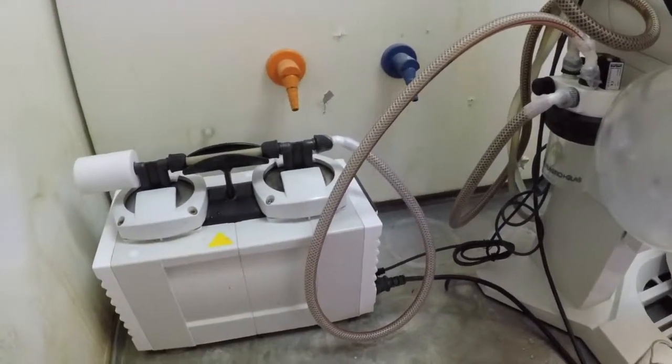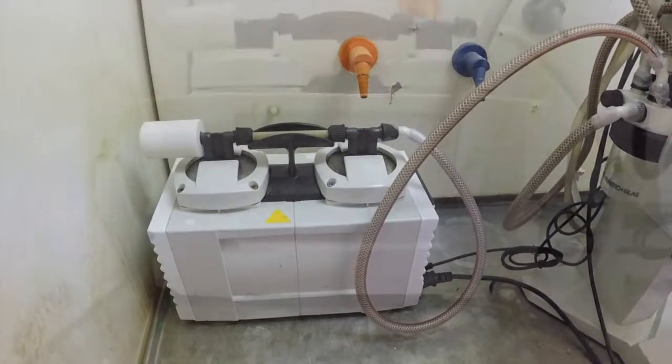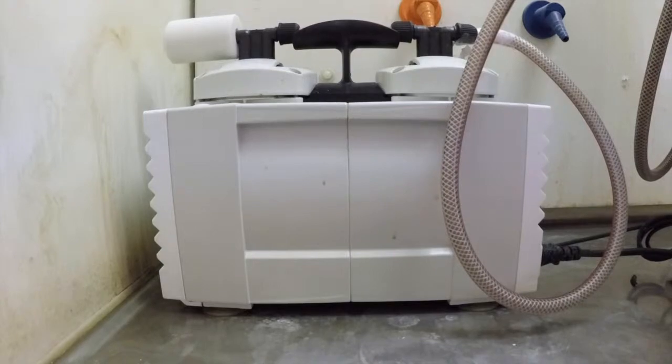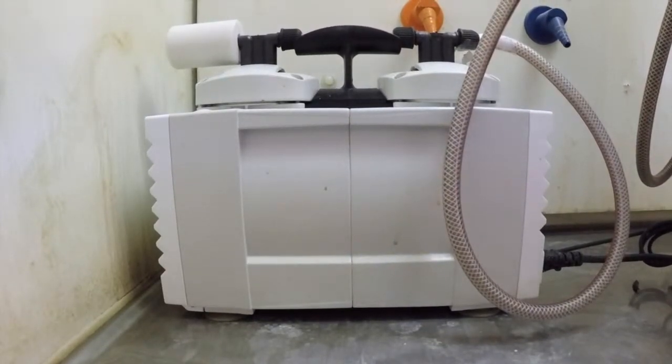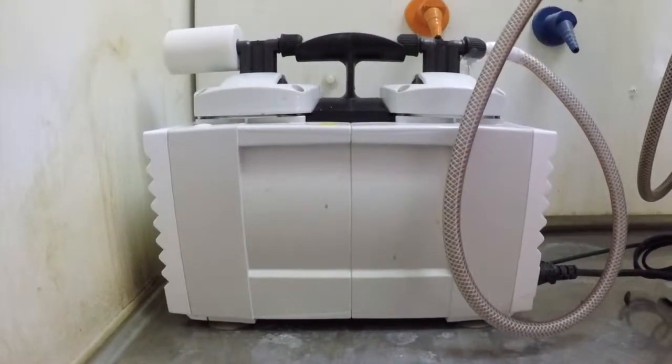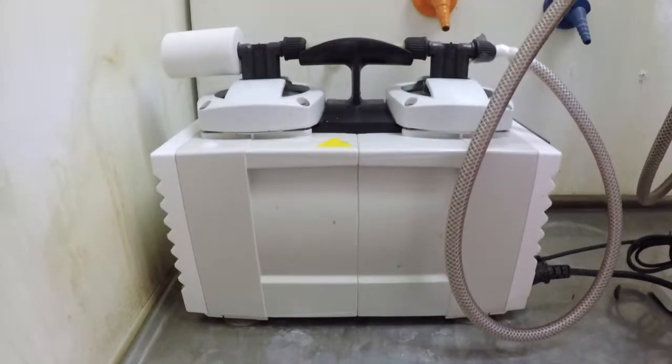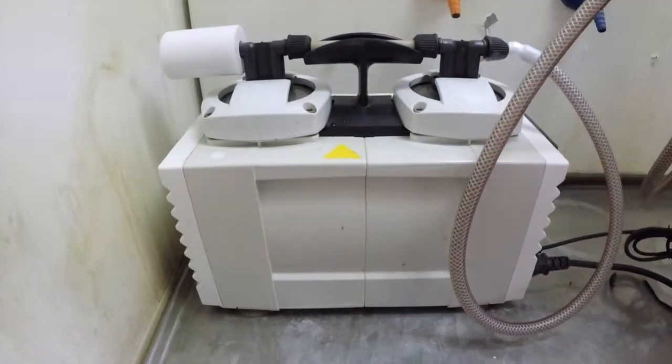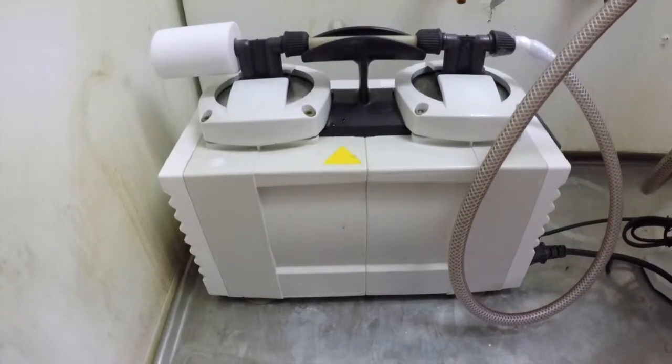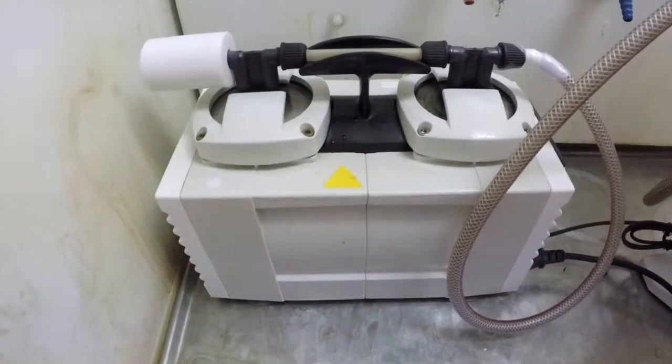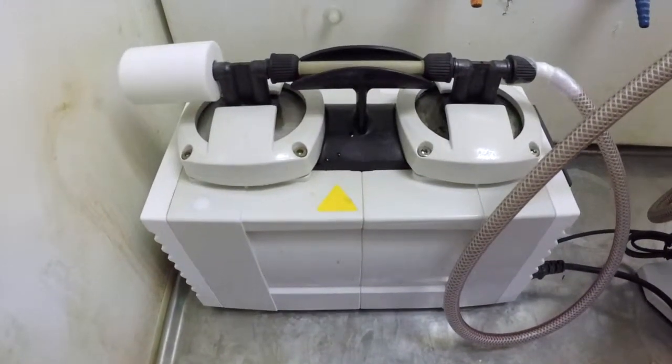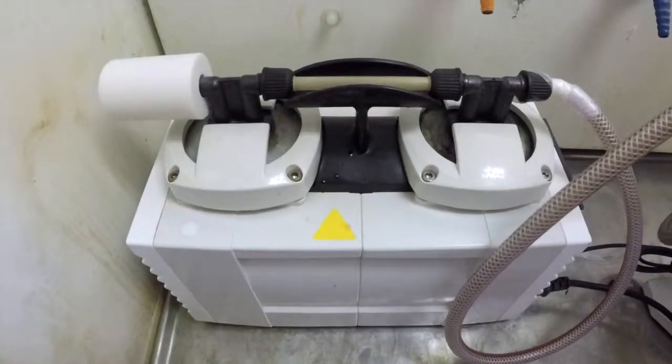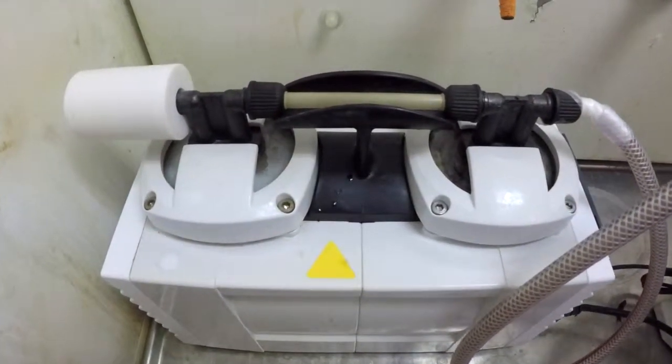This device has an automatic pump, meaning that once the start button is pressed, it will activate by itself. Some rotavapors have water pumps that create the pressure, and it's important when working with those to turn the tap on as far as it will go to create maximum pressure. But this is not necessary for this device as it will turn the pump on automatically.